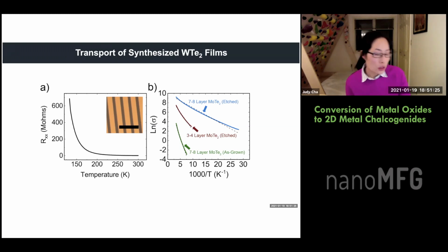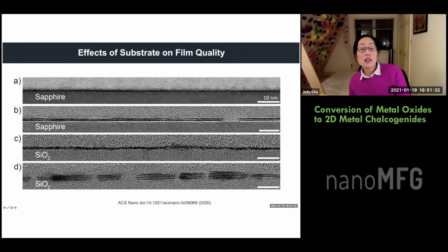Okay, so it turns out that the substrate is very important. Here A and B is moly oxide, ALD deposited onto sapphire and then converted into moly telluride. Then C and D is the same ALD process, but done on silicon oxide, right? By the same group. And when we tellurize it, instead of forming a continuous film, we form islands. Okay, so this was very interesting.